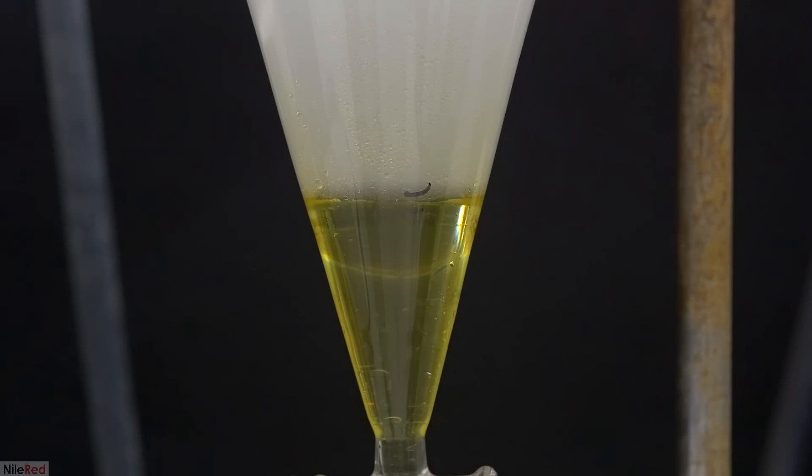It's also very possible that I collected so much water because I used the lazy man method of steam distillation. I'm not exactly sure, but I feel like the proper steam distillation method is a little bit more efficient and if we used it, we wouldn't have collected so much distillate.